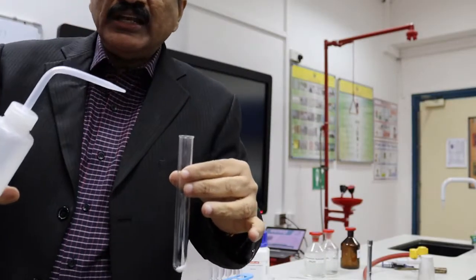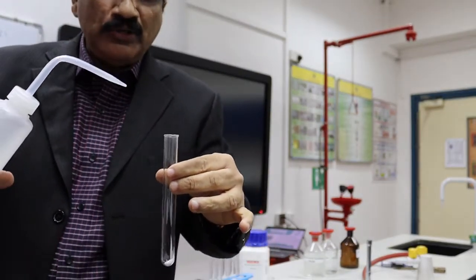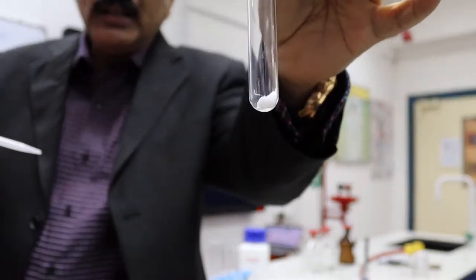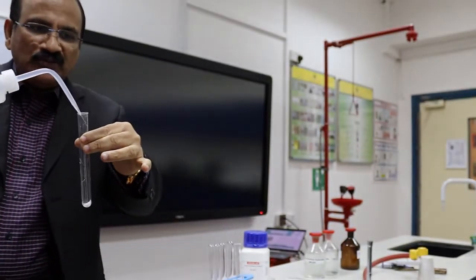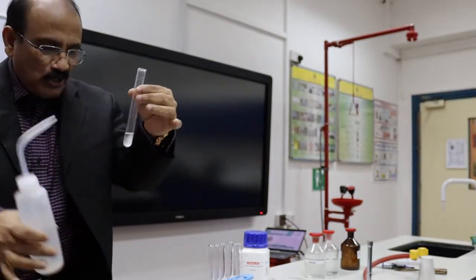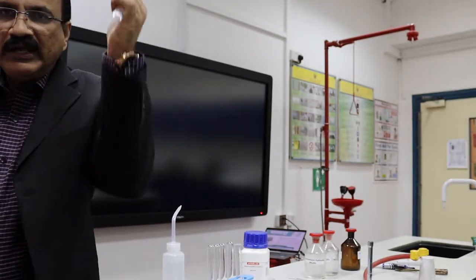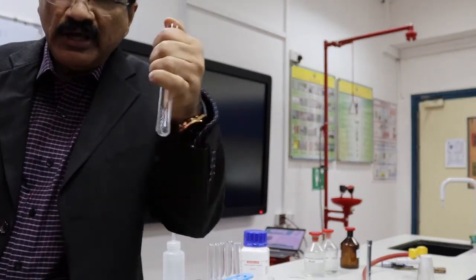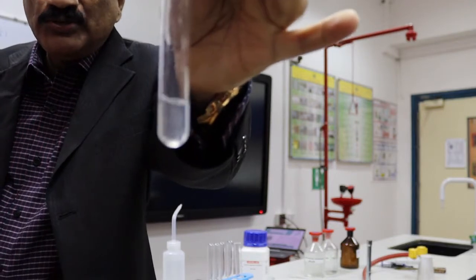So now we are conducting the confirmatory test for chloride ion. For that, the salt is there. Make an aqueous solution of the salt. Put salt, add water, and shake it well. So it is a salt solution, clear solution.